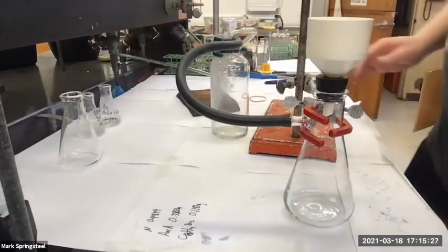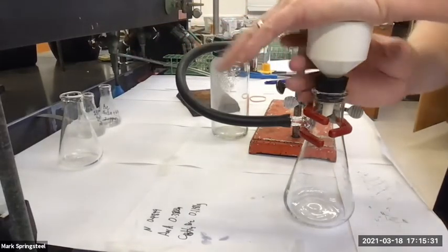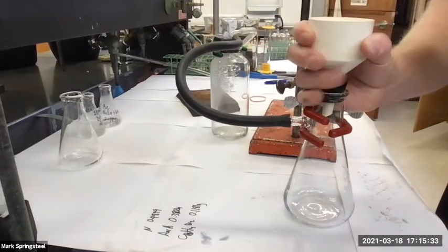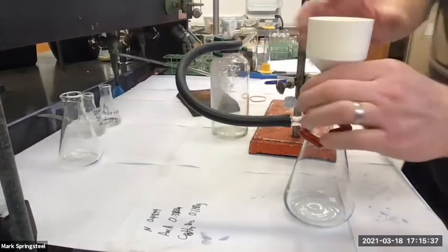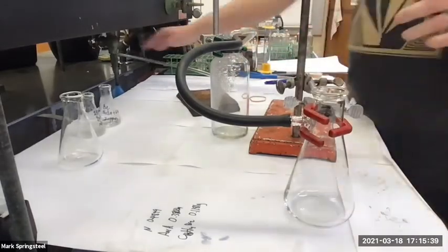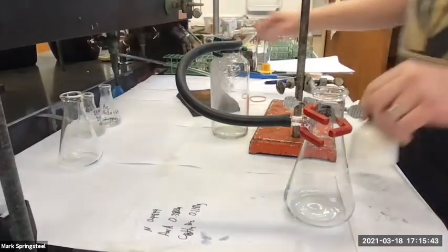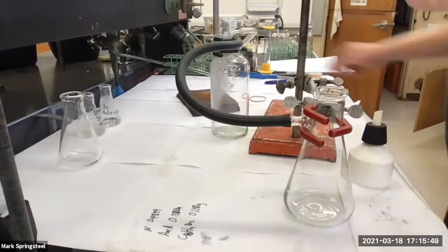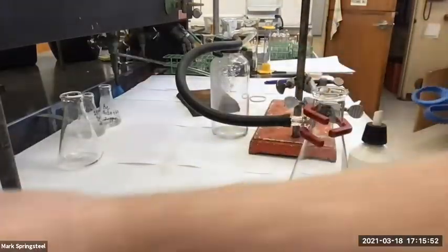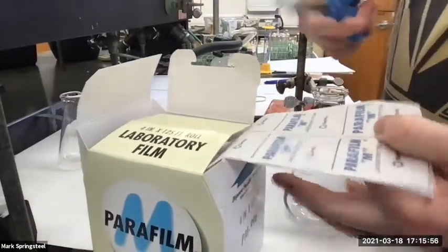Okay, water's on full blast. Oh yeah, I feel it, it's good suction. Did you hear that? And then when I want to turn off the water, I release the vacuum completely. Turn it off. Do you guys want me to check the vacuum again, though, this time the fun way with the parafilm? Yeah. I liked it. You saw it in slow-mo, now you get to see it in real live speed.